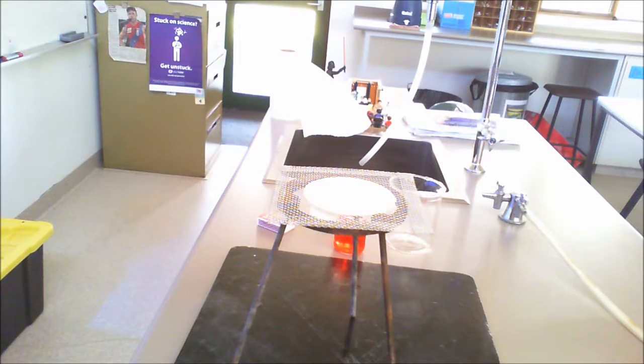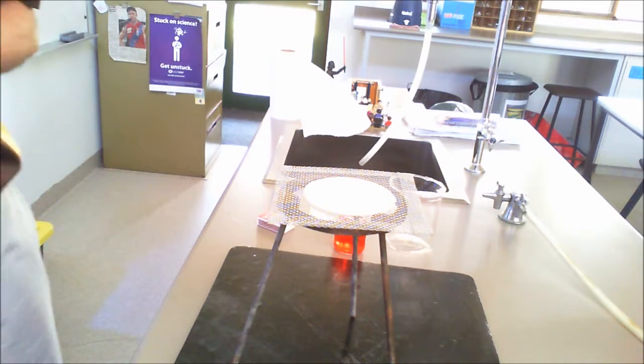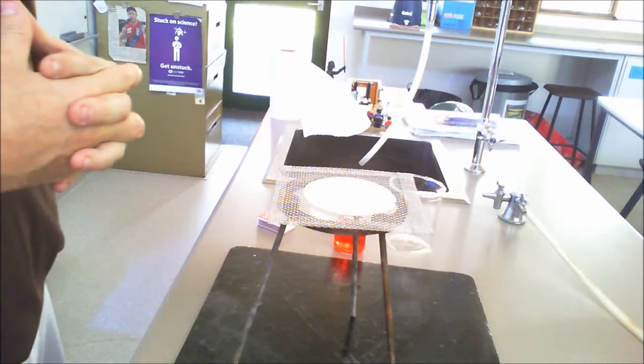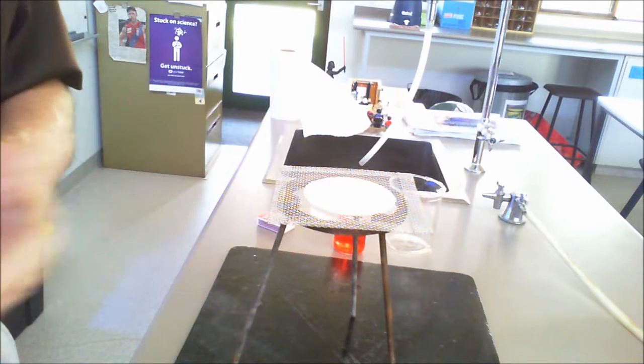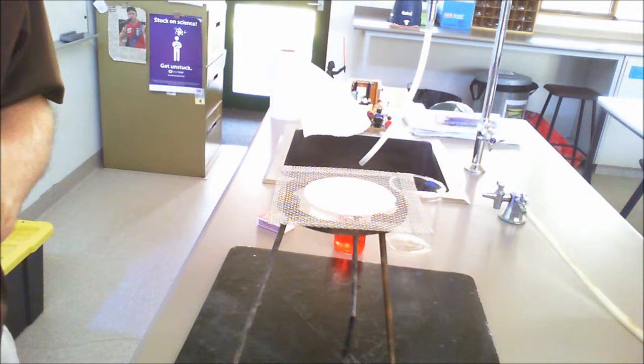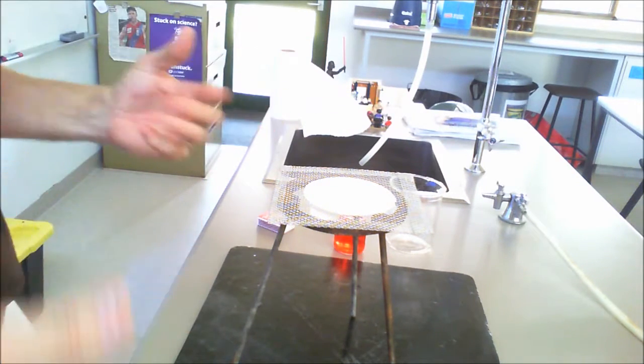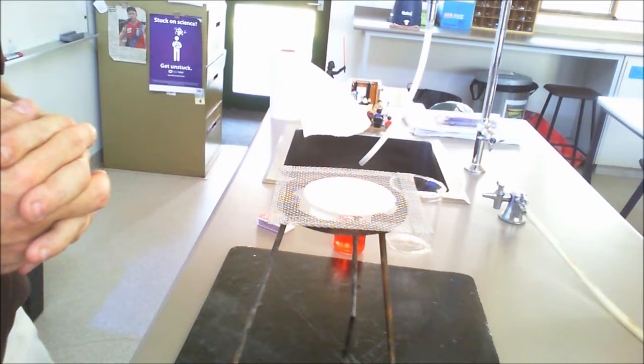Welcome, ladies and gentlemen, to Warwick Science's film practical of the change of states of matter. In this case, we're talking about going from a liquid to a gas, and then a gas back to a liquid. Now, in order to do this, we will actually be boiling the water.